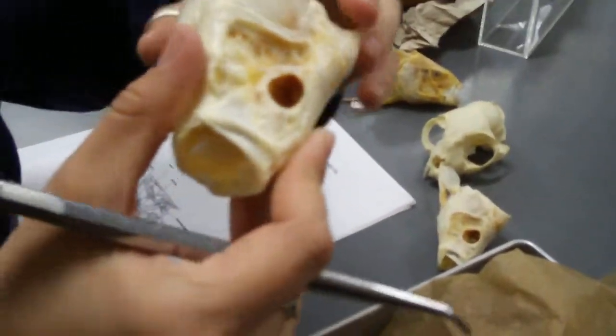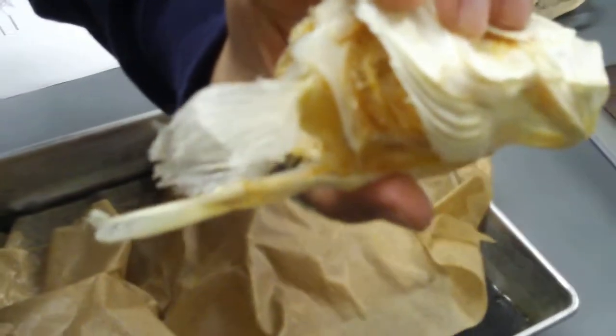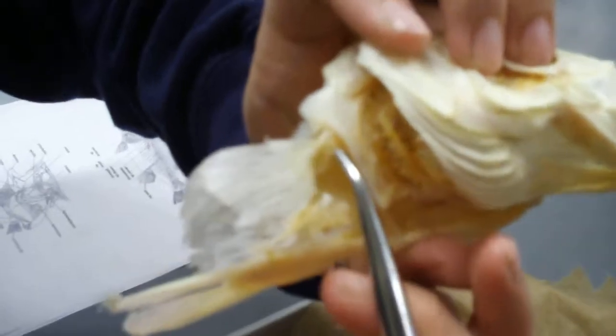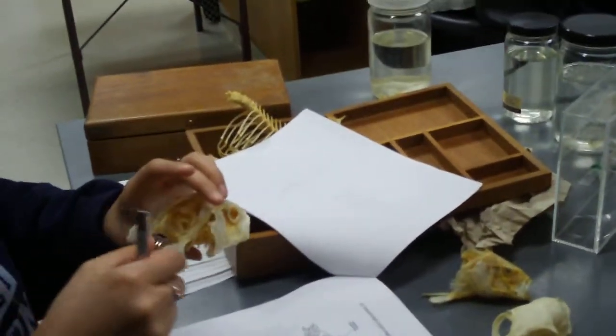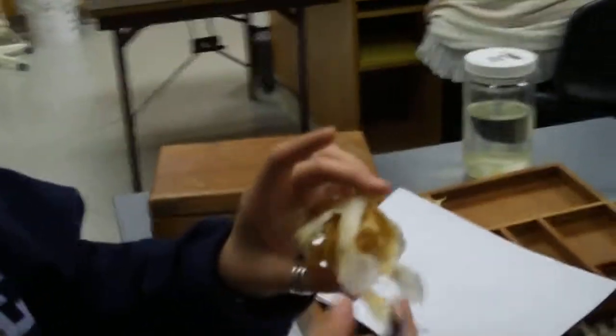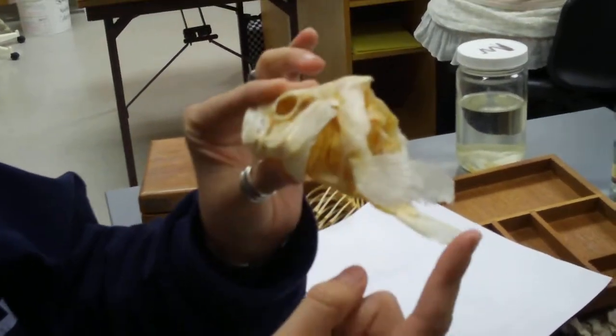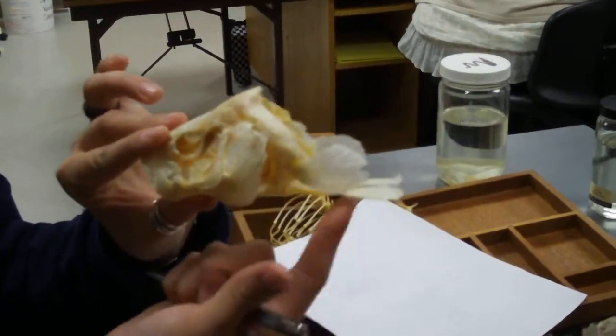Coracoid, scapula. See how it looks? Oh, this side's even better, you can see a definite line right there. Can you see that line? Right there. Coracoid, scapula. And this is a pectoral fin. And as you'll learn, perch are a highly derived species. Their pelvic fin has moved really far forward, that's their pelvic fin right there.